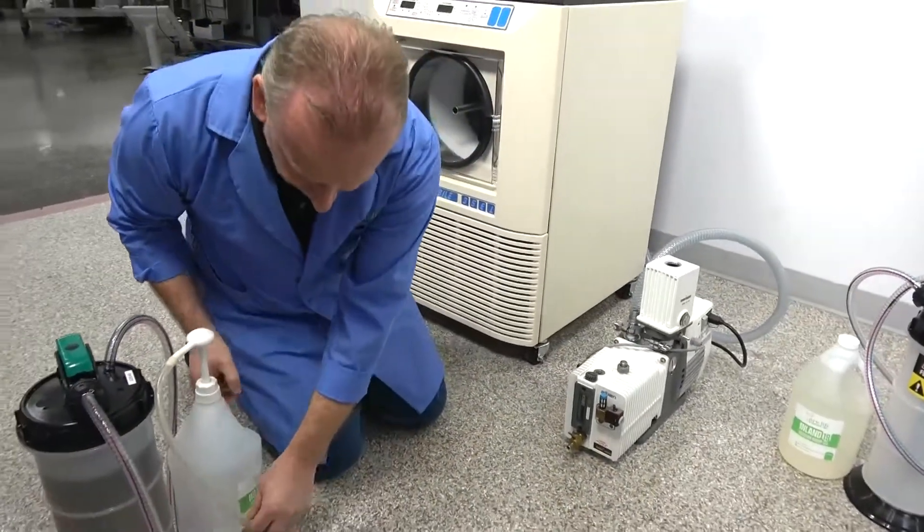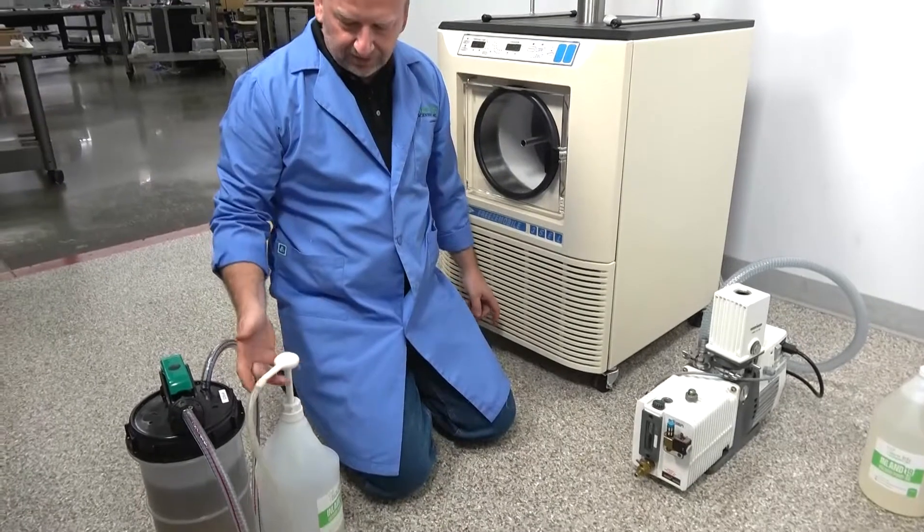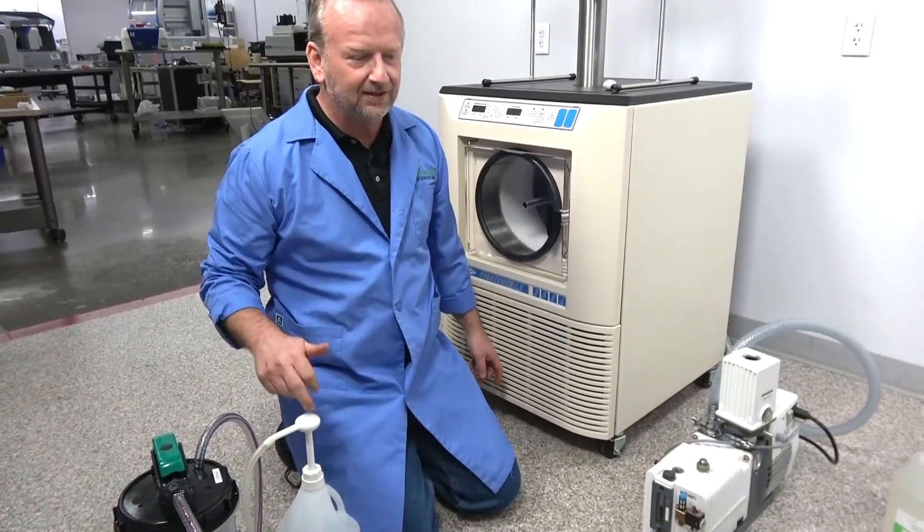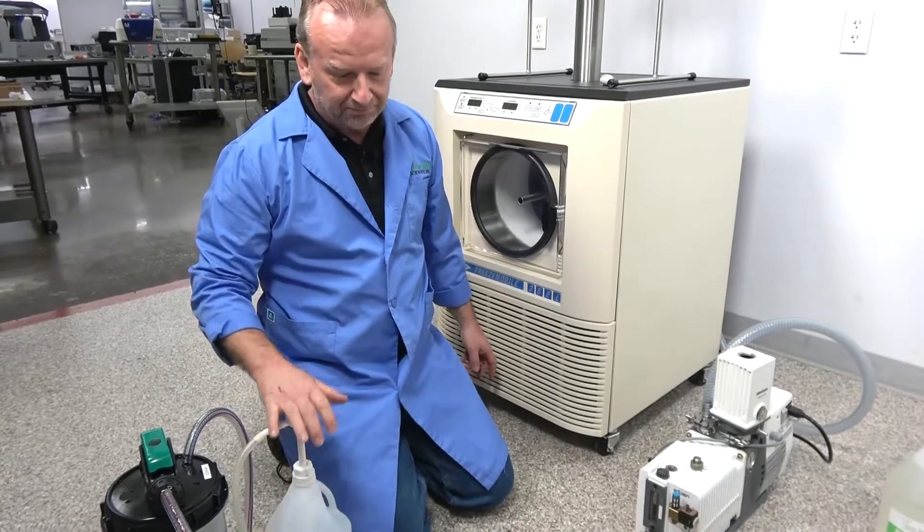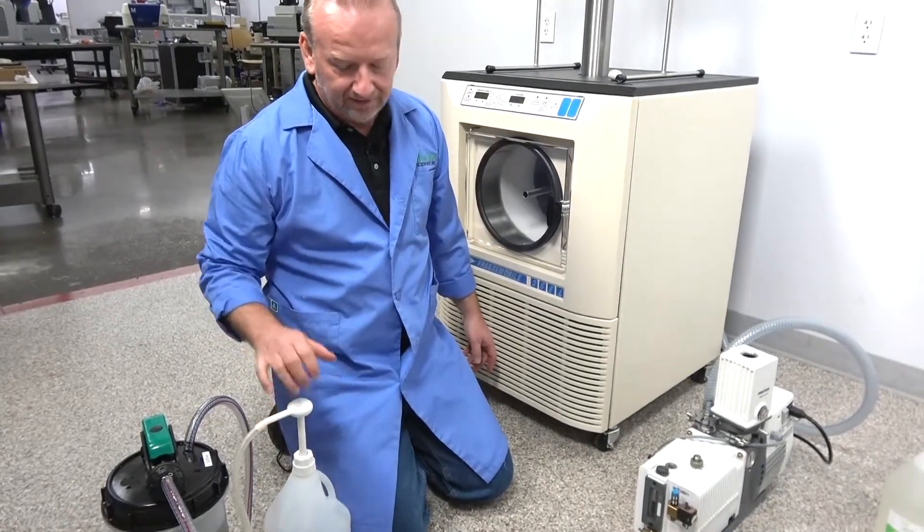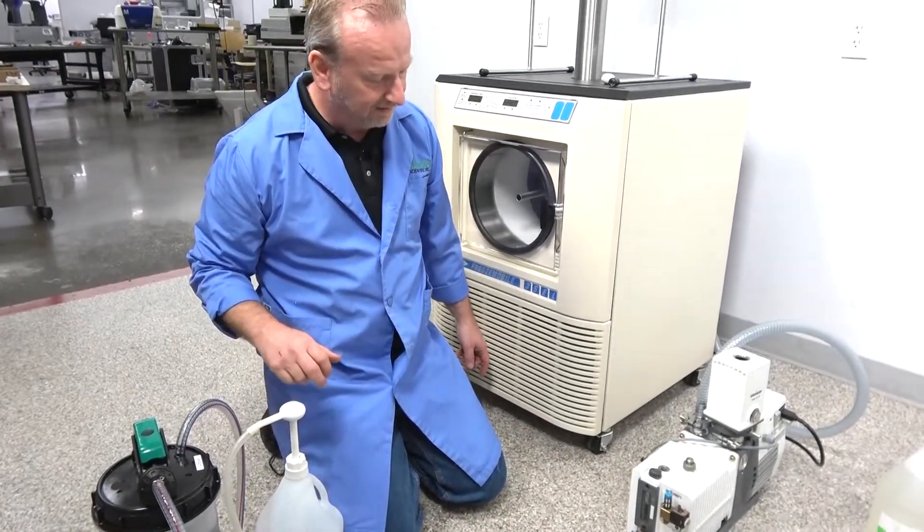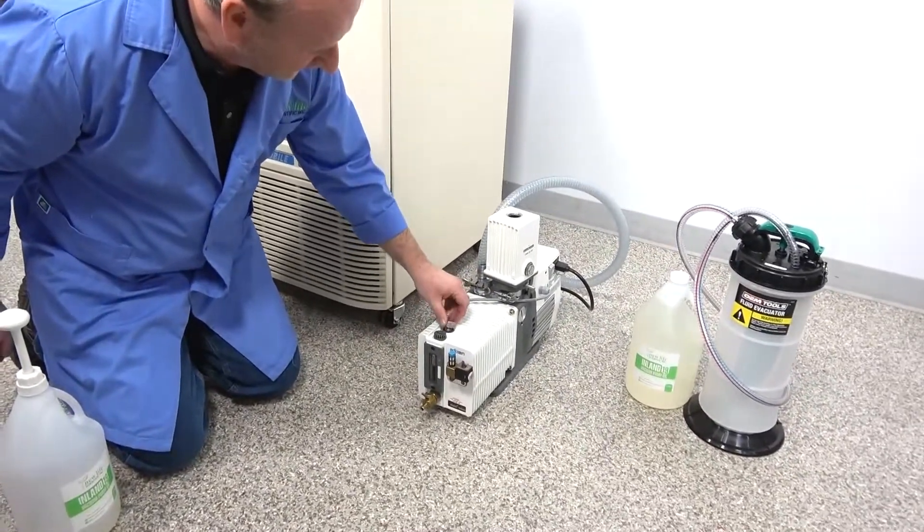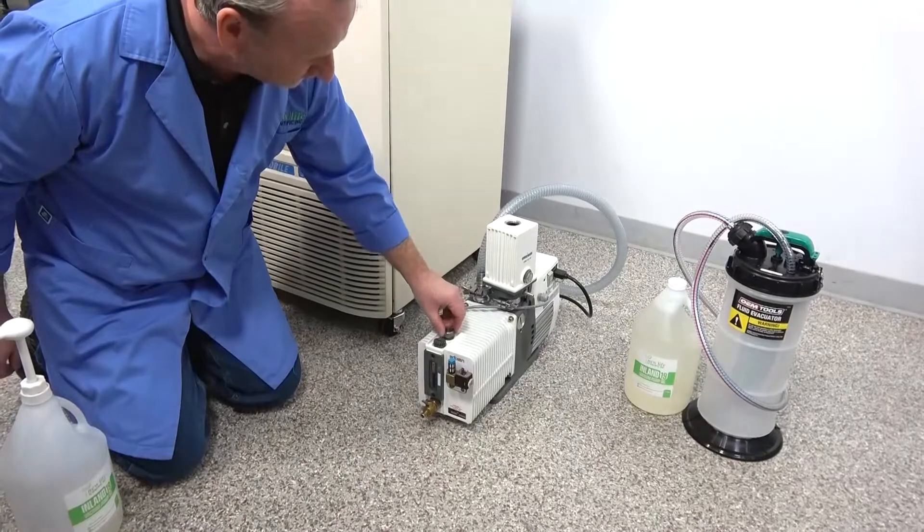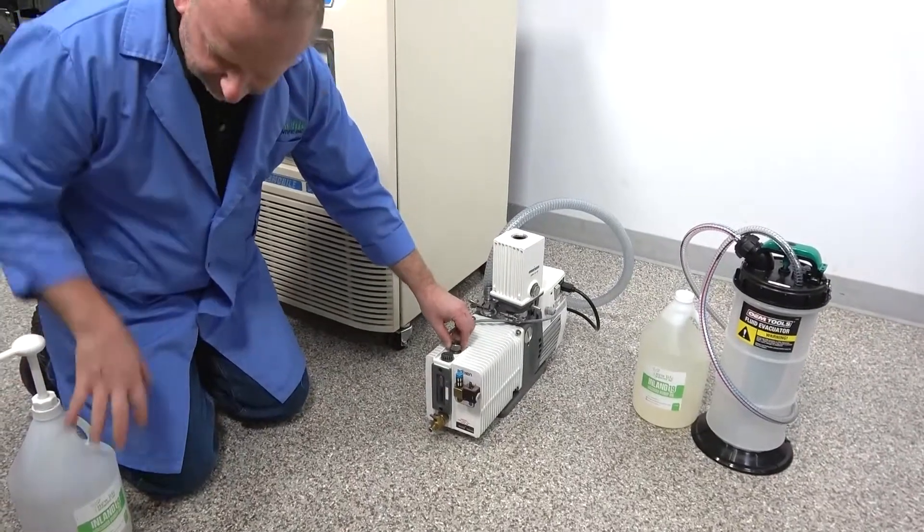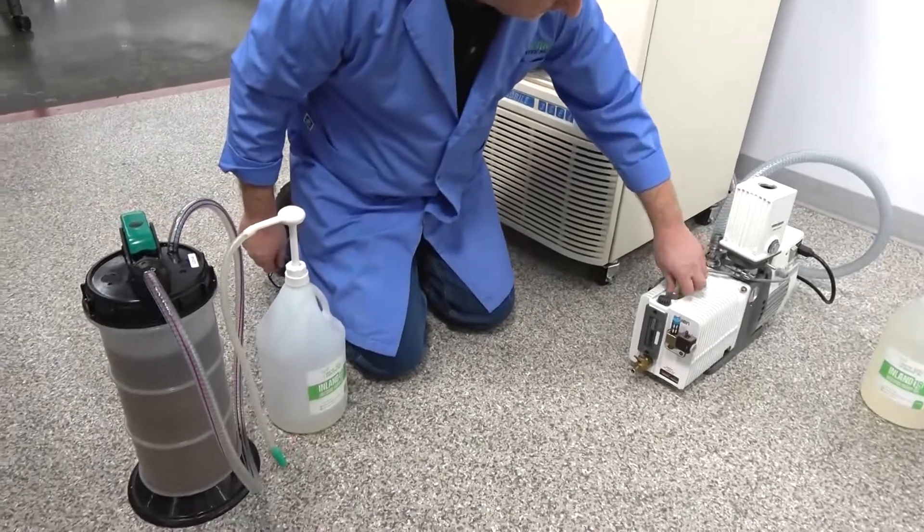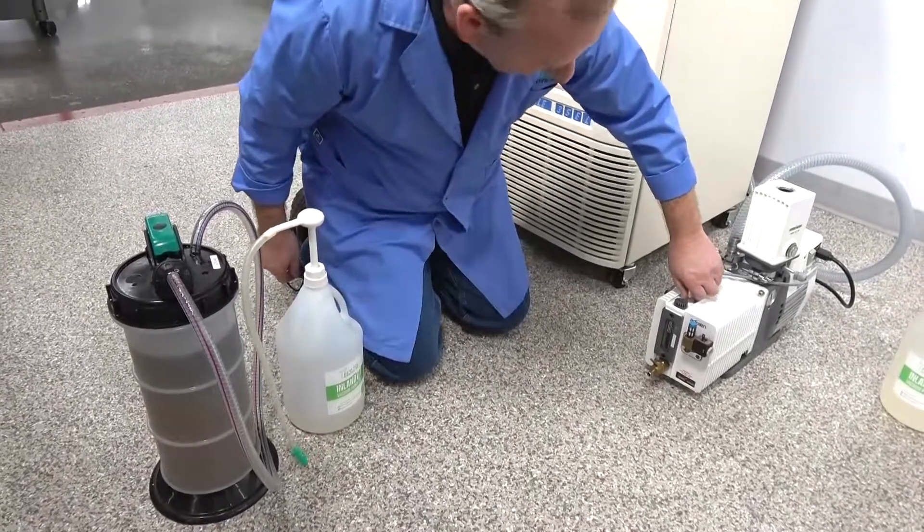So we give you the gallon of oil. We do have some of these available too. So if you see this video and you say, hey, Rich said I'm going to give you a dispenser pump, we're going to give you a dispenser pump just like this one here. If you call in and tell Josh, you are getting the gallon of oil and you're getting the evacuator. So you just put that back on and it's ready to go.